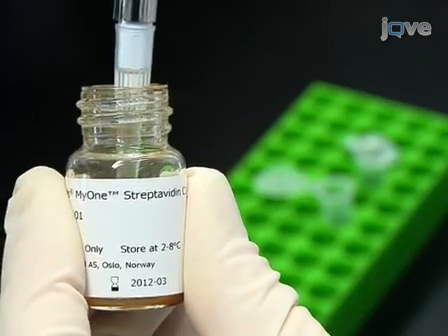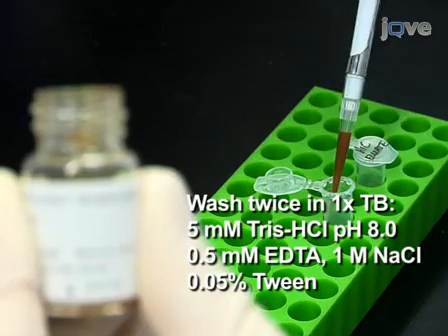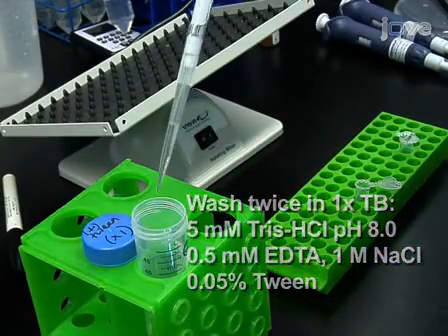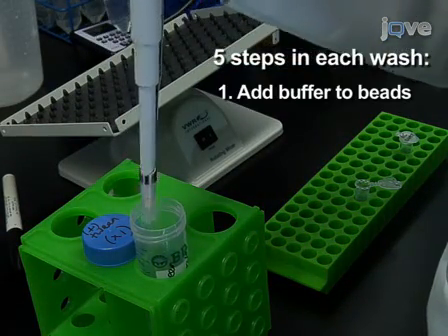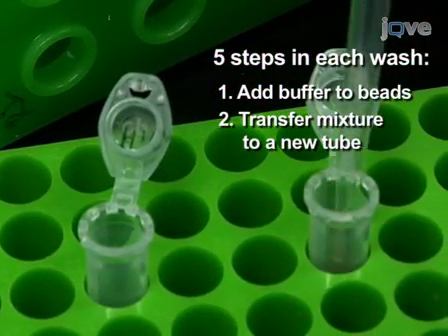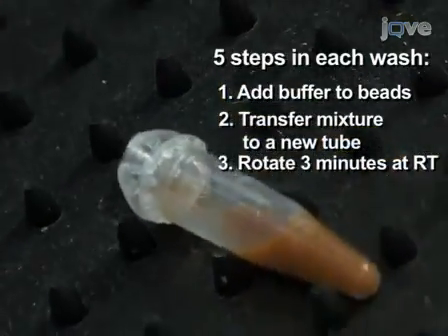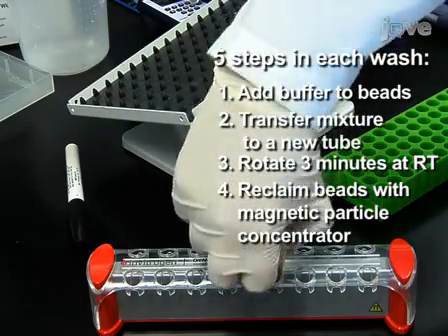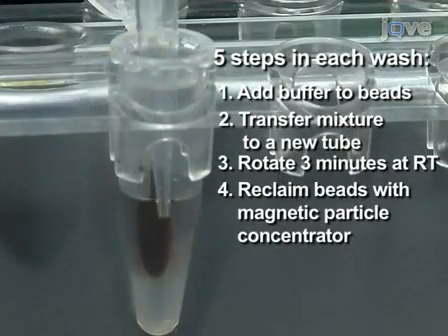Prepare beads for biotin pull-down by washing 150 microliters of resuspended magnetic streptavidin beads twice with 400 microliters of 1x tween buffer. These and future washes consist of 5 steps: adding buffer to the beads, transferring the mixture to a new tube, rotating the sample for 3 minutes at room temperature, reclaiming the beads using a magnetic particle concentrator, and removing the supernatant.